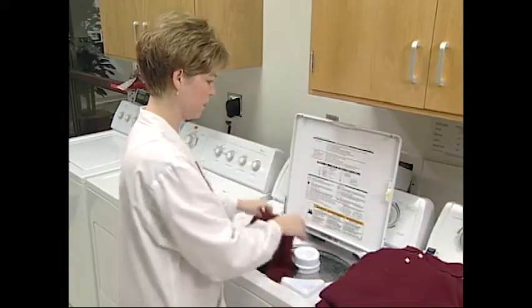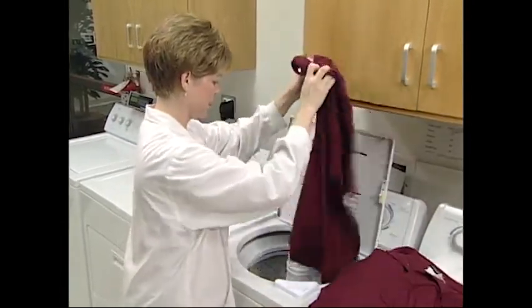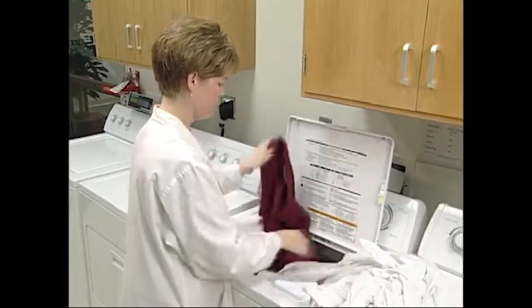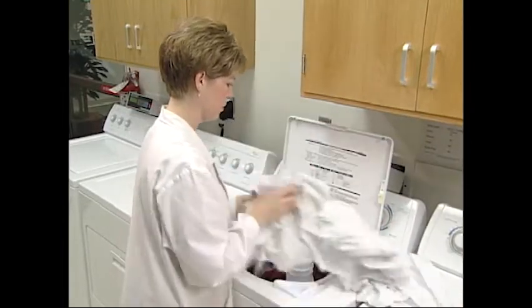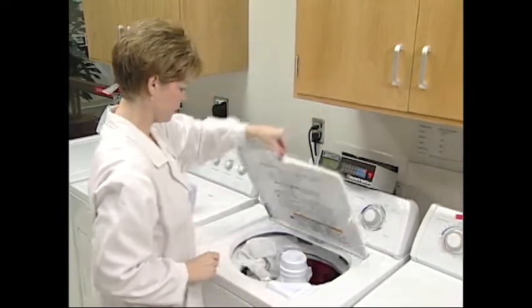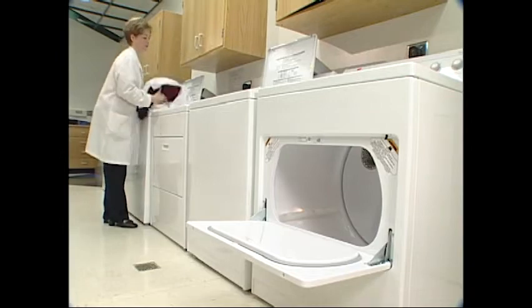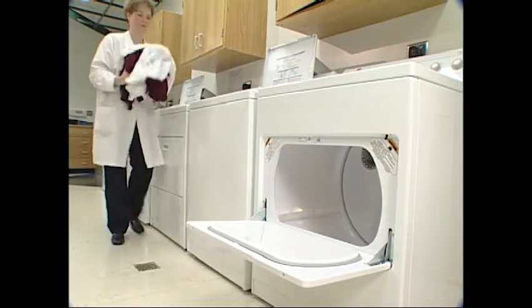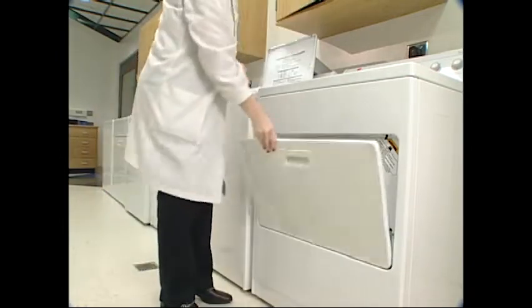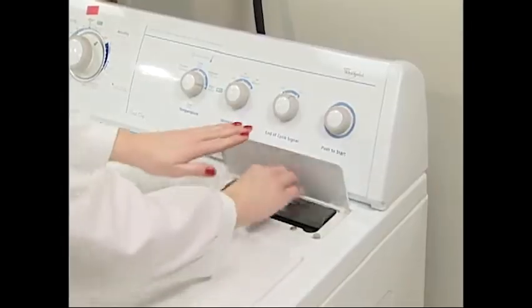Set the washer for a 12-minute normal cycle. Add the required amount of standard detergent and allow sufficient time for the detergent to mix with the water. Next, add the weighed sample load and close the lid. At the end of the wash cycle, transfer the washed sample load into a dryer. Any loose or tangled thread should be cut off at this time. Next, clean the lint filter.